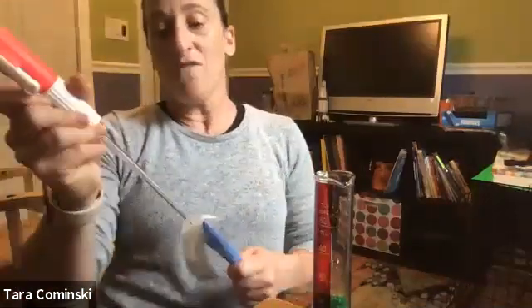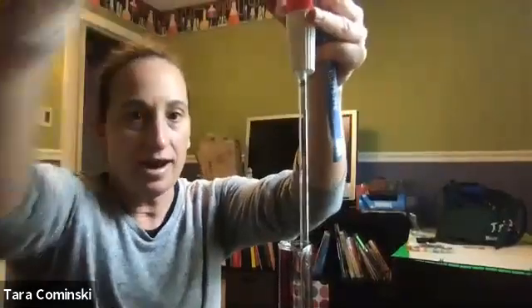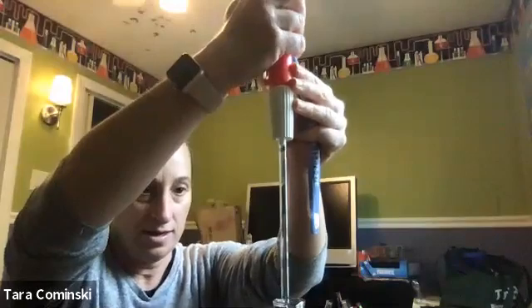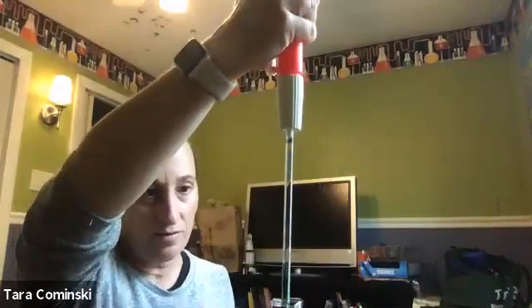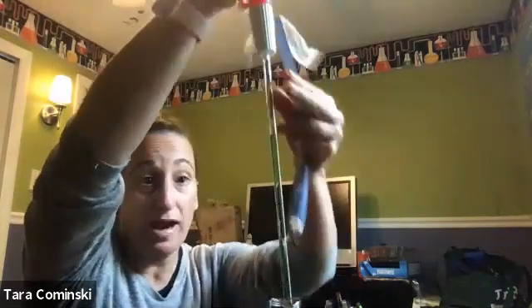So if I wanted to measure 5 milliliters, I can use something like this, which is called a serological pipette, right? And so basically what I can do is I can put this in here. Sorry, let me pull this back a little bit, right? And I can basically draw up the liquid. We'll see. Okay, and I can draw it up to whatever known amount that I want, and this would be 5. Nope, I go all the way up to the 0 there. This would be 5 milliliters. Okay, so that's one way to measure 5 milliliters.